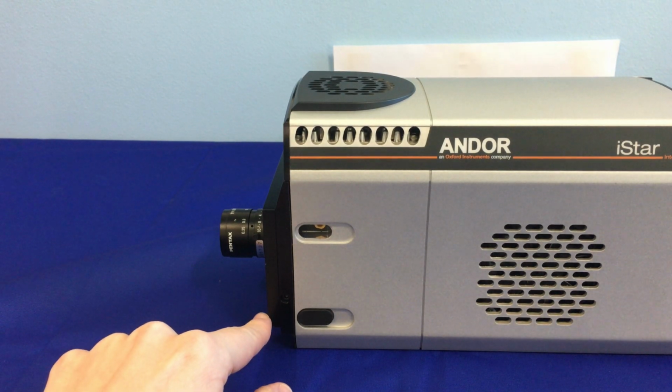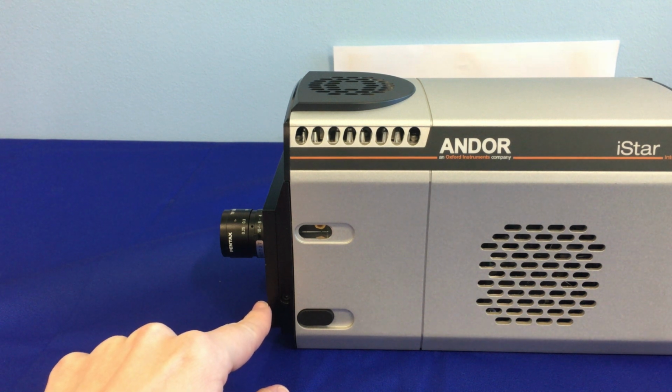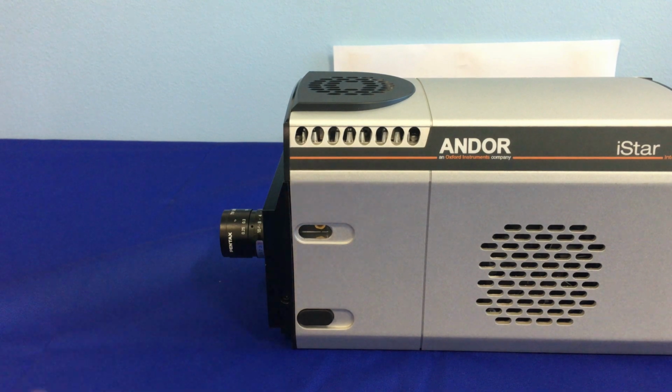And down here we have a dry gas channel to help remove heat from the photocathode. And so you can blow cold air through this, and this helps to minimize your EBI thermal noise. And this can be particularly useful if you're doing some kind of photon counting application.